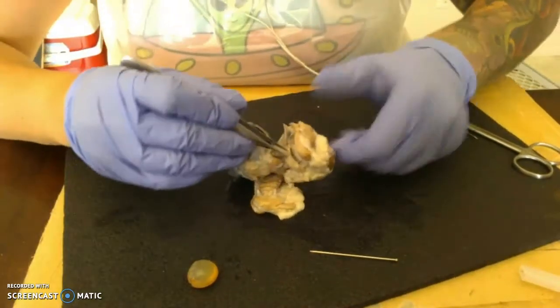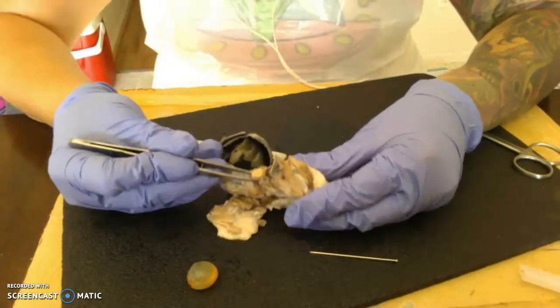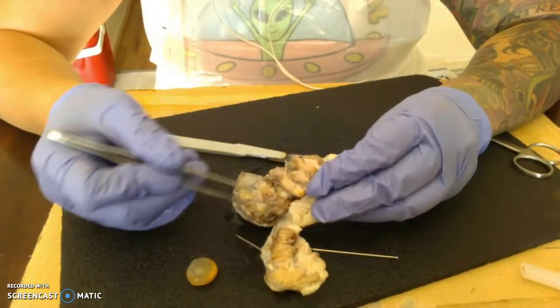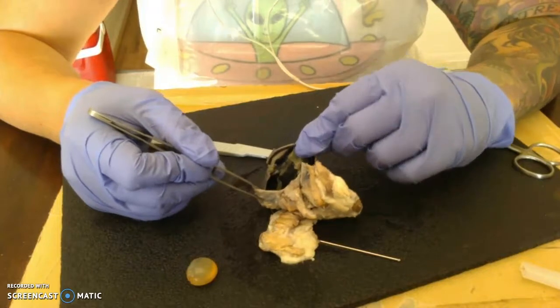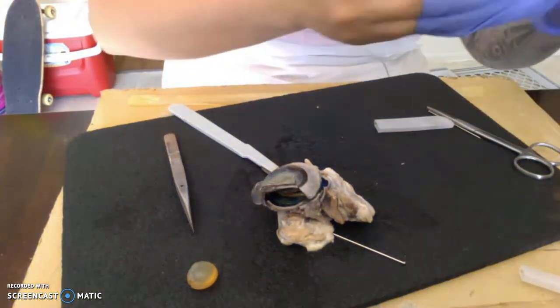And then we can come back over here, and this is going to be our optic nerve. And you can additionally see the muscles. I didn't know how to know which aspect of the eye was from the top or bottom, so I couldn't identify muscle features, but there you go. There's our eye and our 12 anatomy structures.